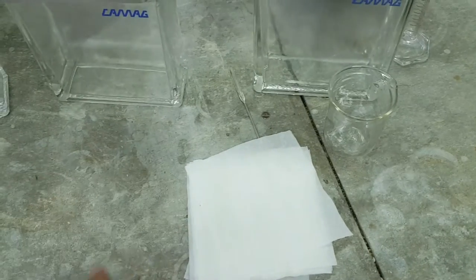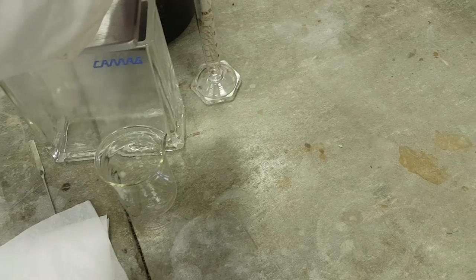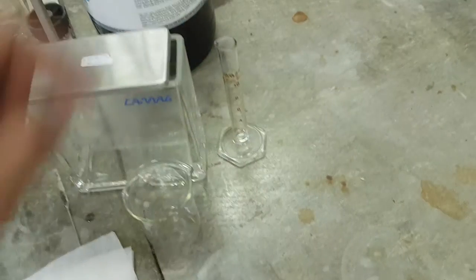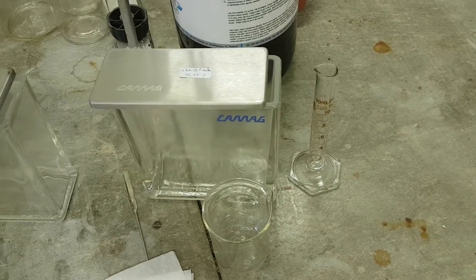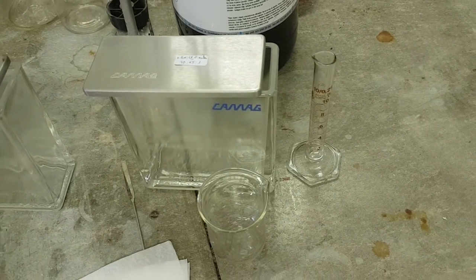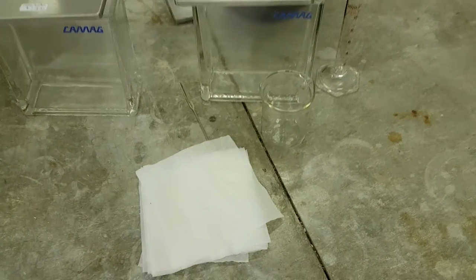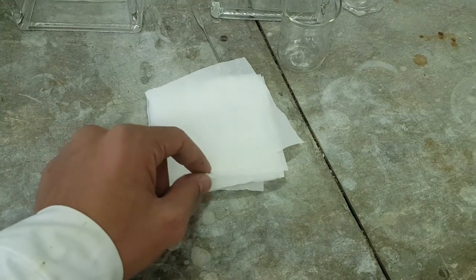A spatula, of course, to stir your mixture, and also you need to prepare the amount of solvents that you have. A napkin is very useful.